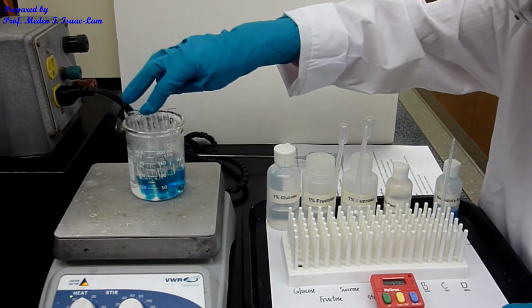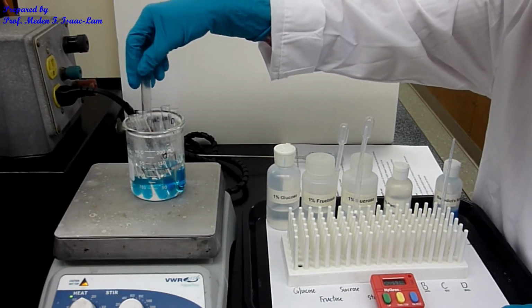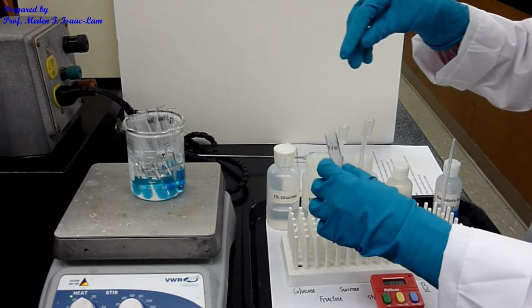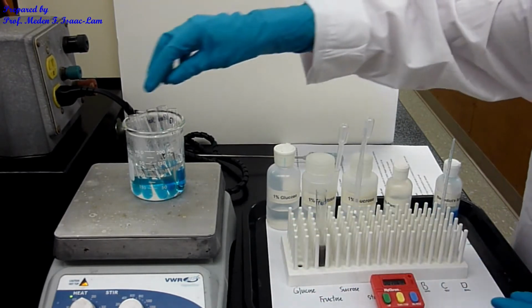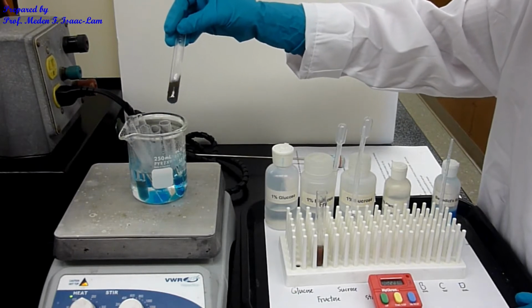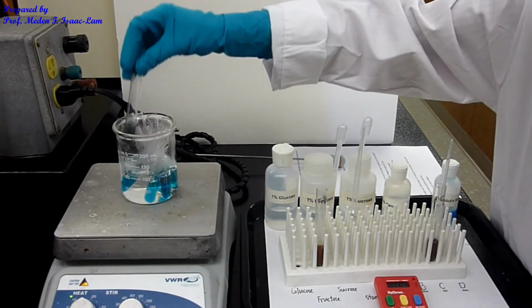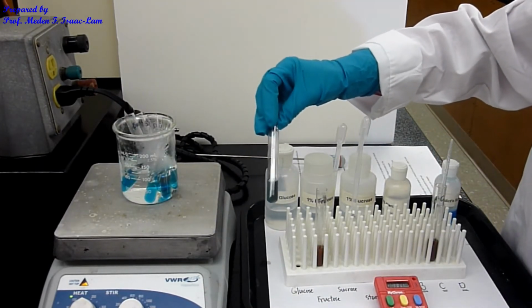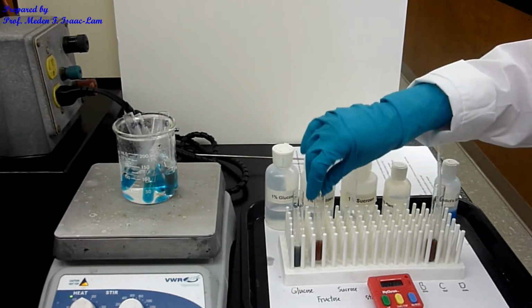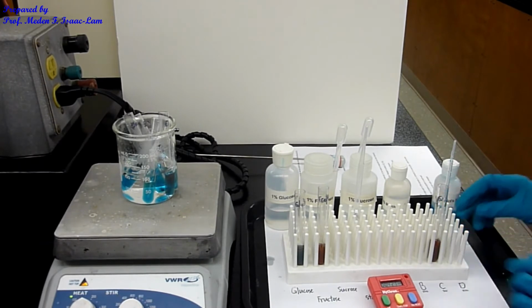50 seconds. Let me take that out. The fructose actually turned reddish. I'm going to take it out. Now for the unknown, I see that C also turned color. I'm going to put it back in here. And then now the glucose changed color. It's not deep blue anymore. So the first ones that reacted were the fructose and also letter C for the unknown. And then next is glucose.